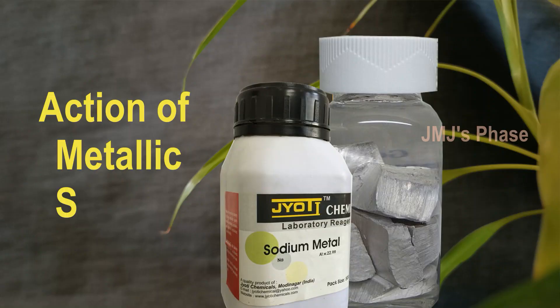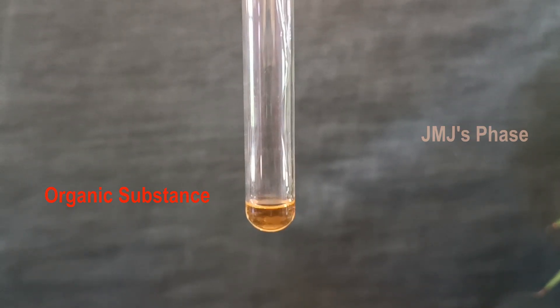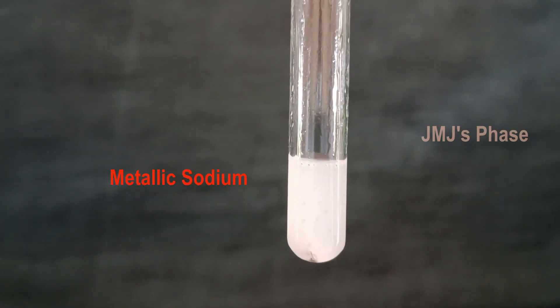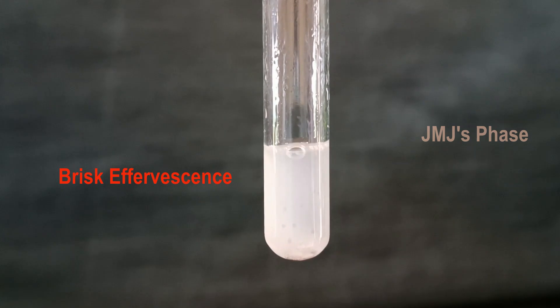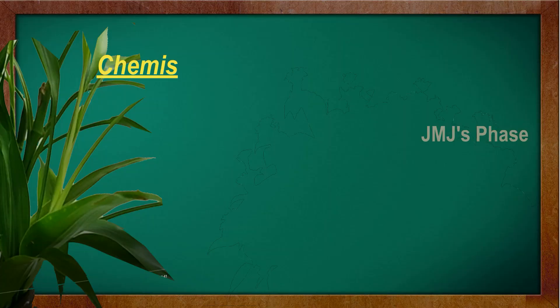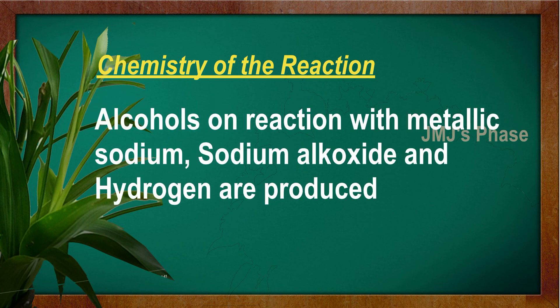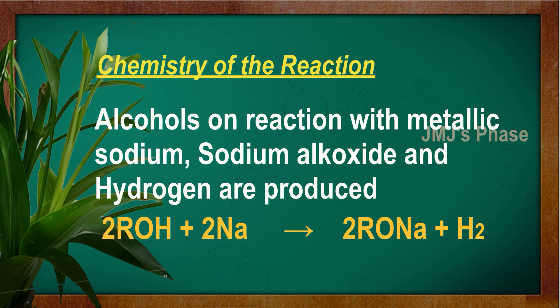Action of metallic sodium: Take a little of the substance in a dry test tube, dissolve it in dry benzene, and add a piece of metallic sodium into it. The formation of brisk effervescence indicates the presence of alcohol. The chemistry of the reaction is that alcohols react with metallic sodium to produce sodium alkoxide and hydrogen, and the brisk effervescence is due to the formation of hydrogen gas.